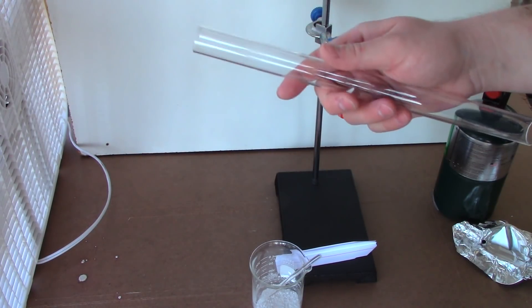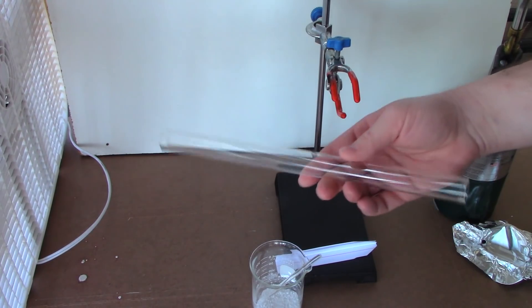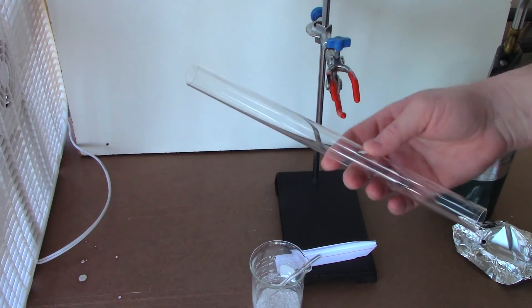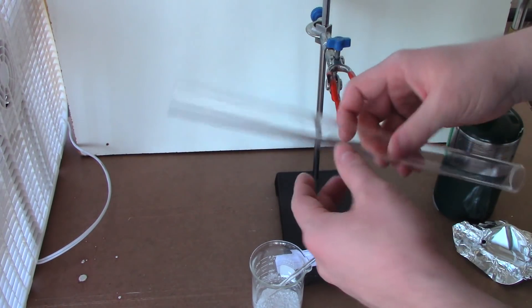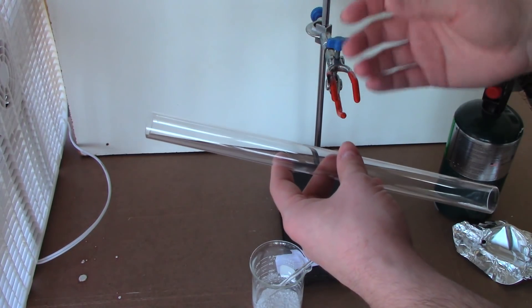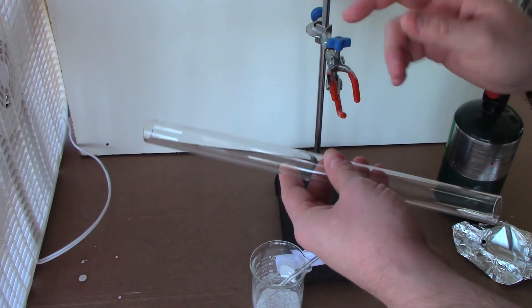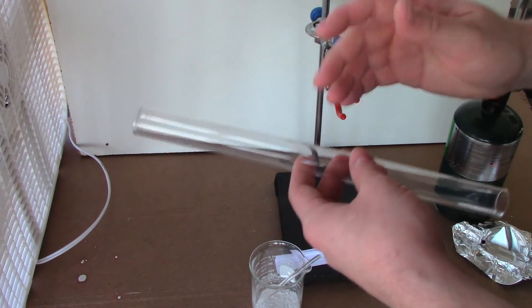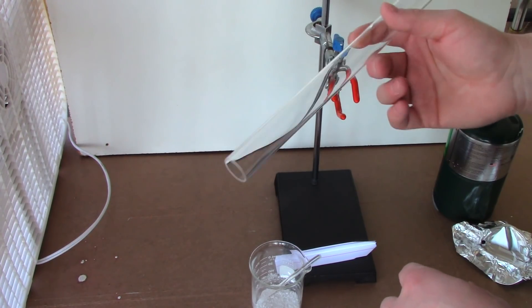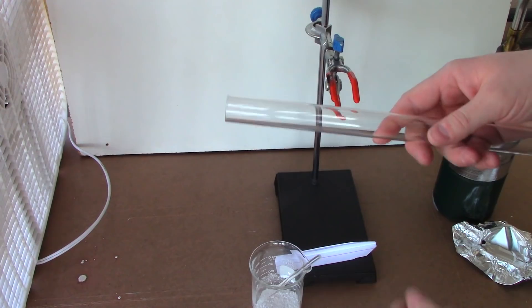You can see I have what looks like a glass tube. Now, despite looking like glass, this is not. Well, I guess it technically is a type of glass. This is quartz glass, or fused silica. This tube here actually came out of a UV sterilizer. For quartz glass tubes, UV sterilizers are a good ticket. You can find replacement quartz sleeves for them. Pretty cheap. And, I mean, they're nice glass. The reason they use them is borosilicate glass and I think regular soda glass really don't transmit UV. Well, allow UV light to pass through them very efficiently. Whereas quartz glass is like over 99% transparent for UV. Now, the other huge benefit with this being quartz glass is it can handle insanely high temperatures. I think the service temp for this stuff is like 1100 Celsius. So, perfect for doing thermal decompositions in. Because we can just heat the shit out of the outside of this tube with our bismuth nitrate in there and decompose it.